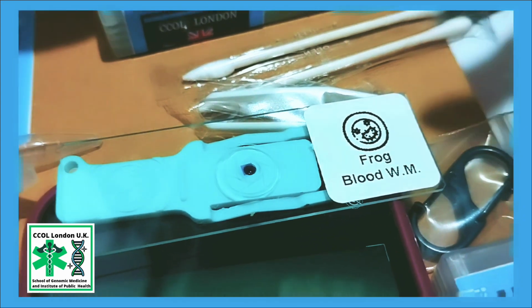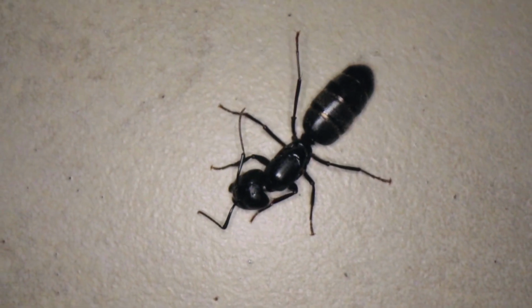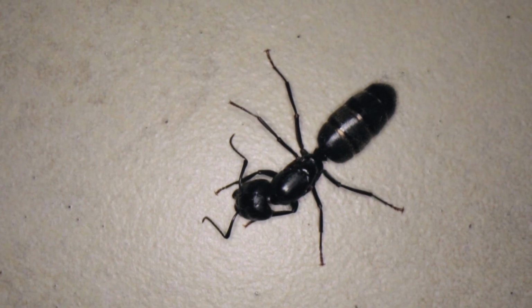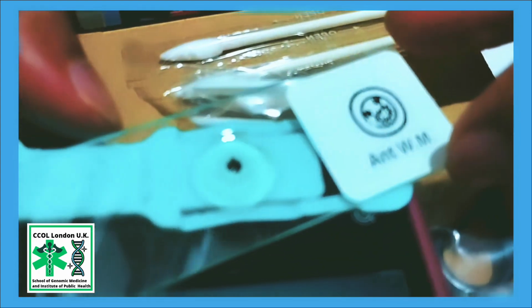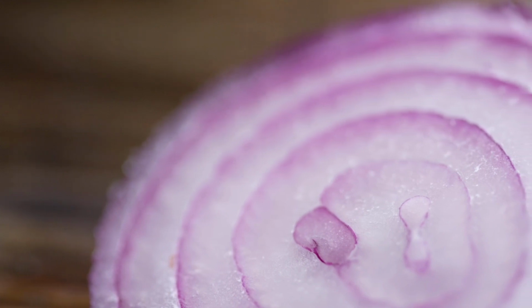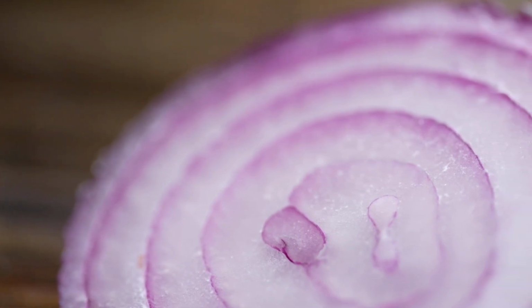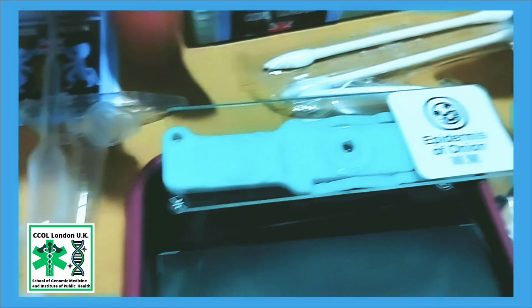Now I have another sample also, so I'm just putting in another slide. Now this is an ant. As you can see, the whole body structure of the ant. See, if I move this slide, you can easily see everything. Like this is the head portion. You can see building blocks. So this is the epidermis, that means the outer layer of the onion.